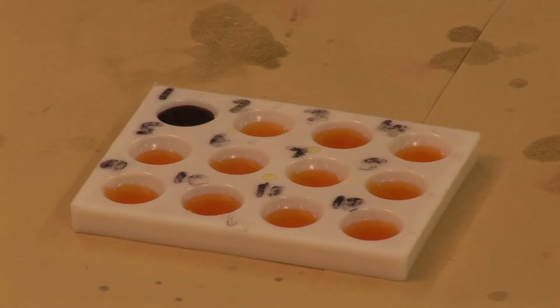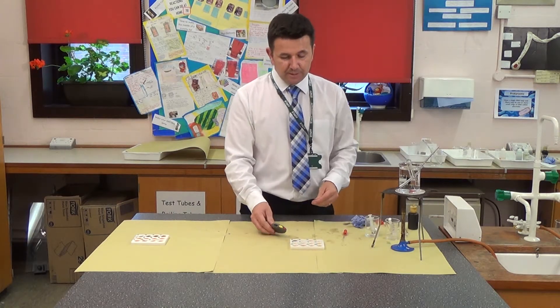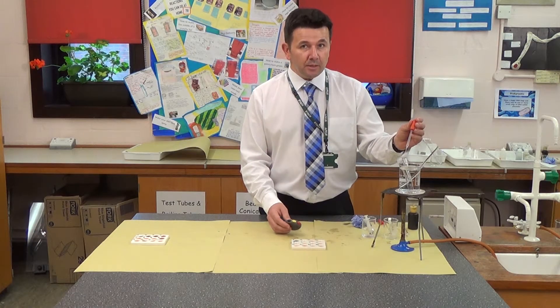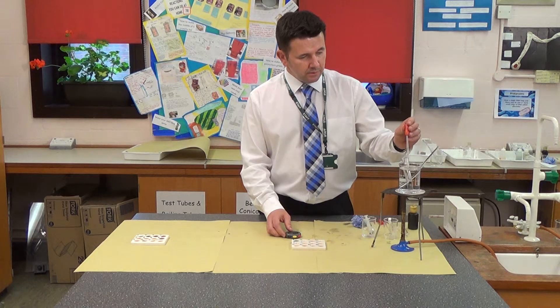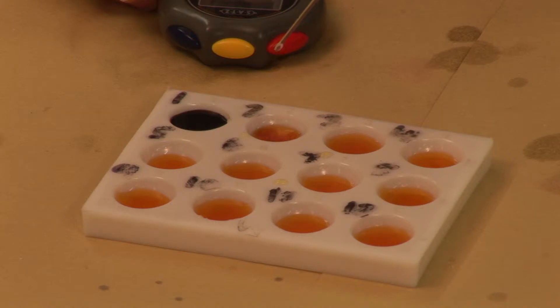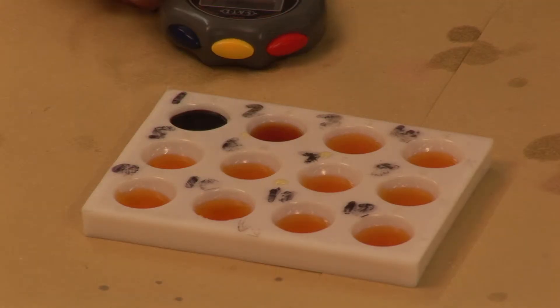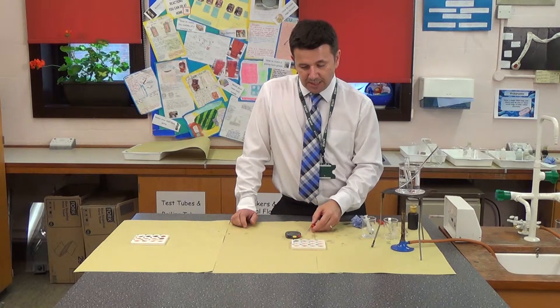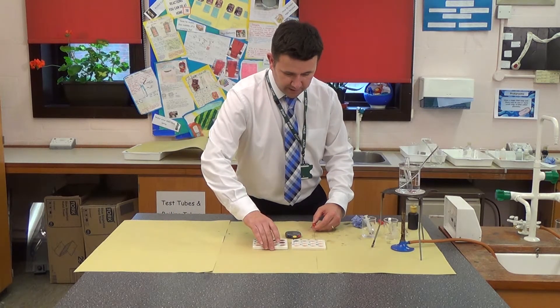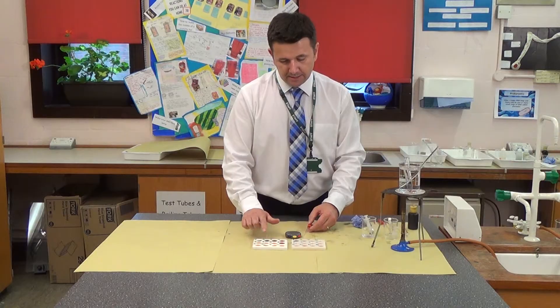You can see it's gone black. After one minute, I take another sample and place it into the dish. There has been a colour change, which suggests the amylase is maybe working slightly quicker than the other sample. Comparing the two: this is at 22 degrees, this is at 47, so you can immediately see there's a difference.